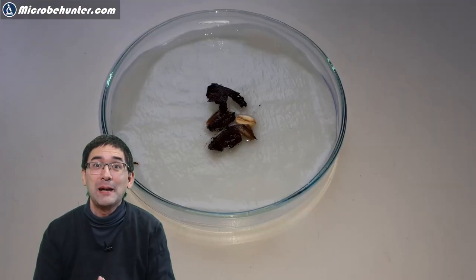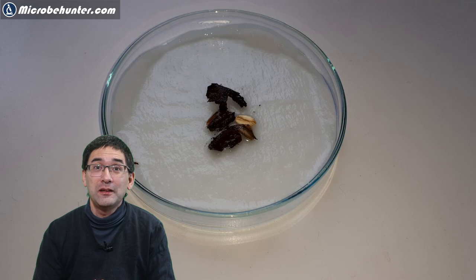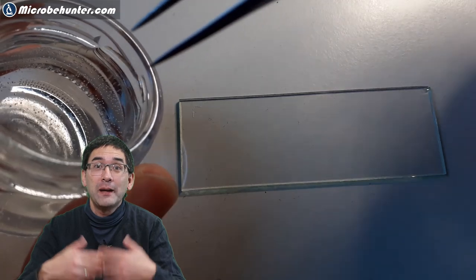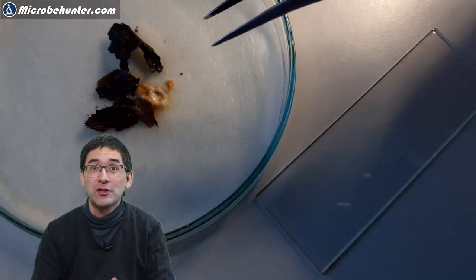This one is a little bit in time lapse. Now it means to stay patient. Of course, I did not only amplify amoeba this way, but also many other microorganisms like nematode worms. I found a whole bunch of ciliates and so on.